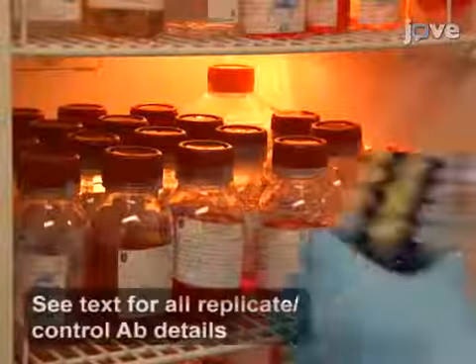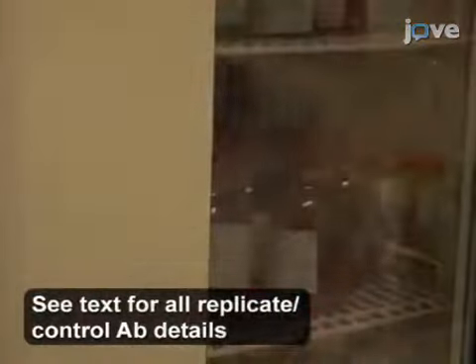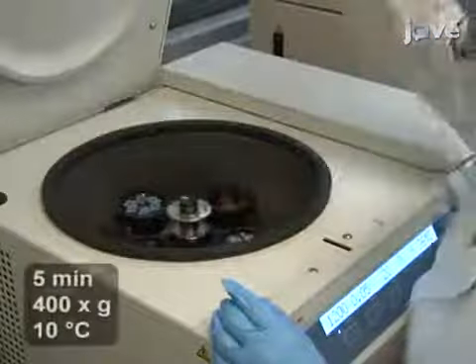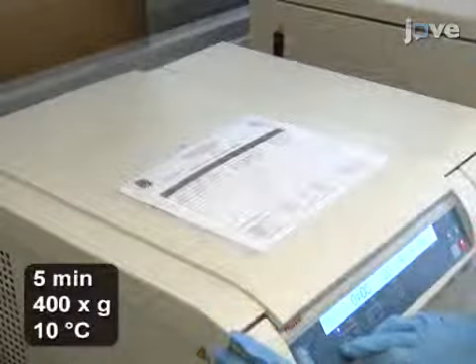When all of the cells have been transferred, incubate the samples at 4 degrees Celsius for 20 to 30 minutes, followed by centrifugation in 1 milliliter of PBS per tube. Resuspend the pellets in 100 microliters.